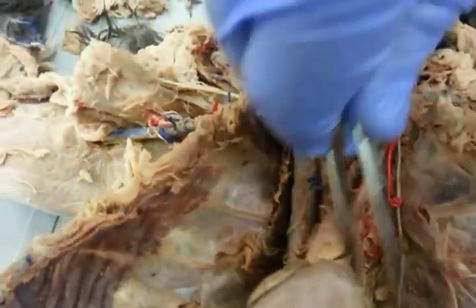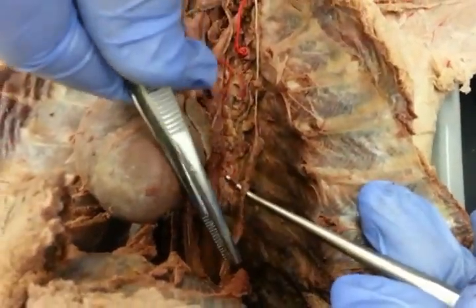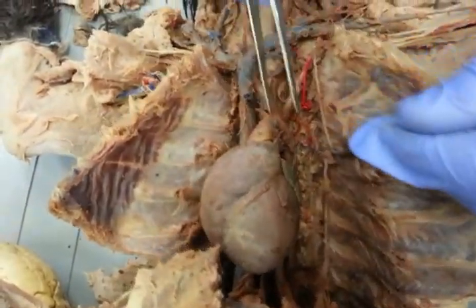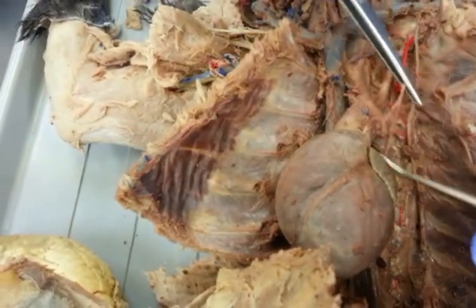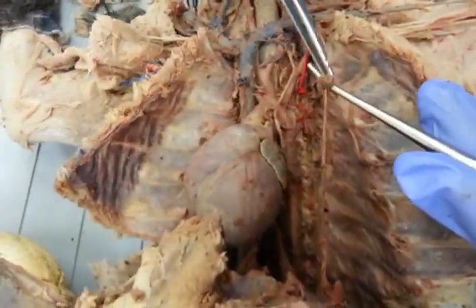All right. One of the only nerves we need to know is this right here. It goes from the diaphragm all the way up, and that's going to be the phrenic nerve. So the phrenic nerve is going to go all the way up, opposed to the vagus nerve, which is going to stop, and you can see that it's going to wrap around the heart. So vagus nerve, phrenic nerve. Phrenic nerve is usually more lateral.